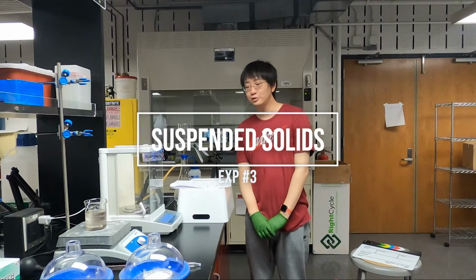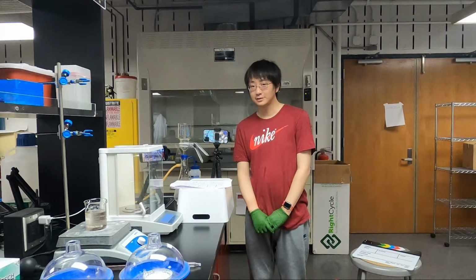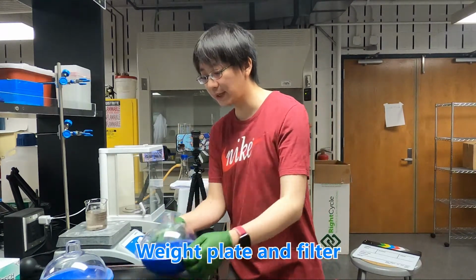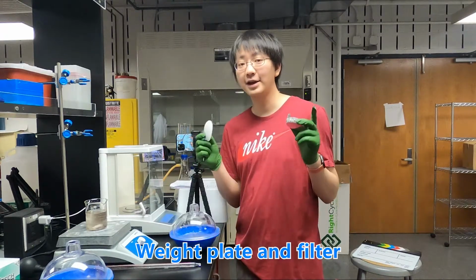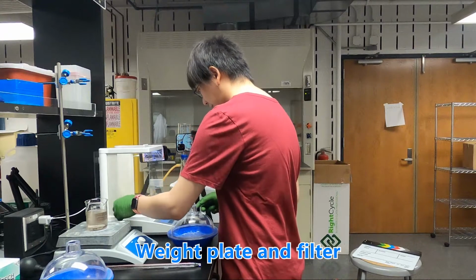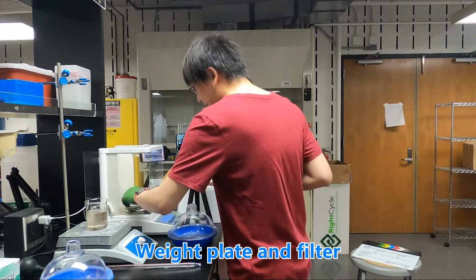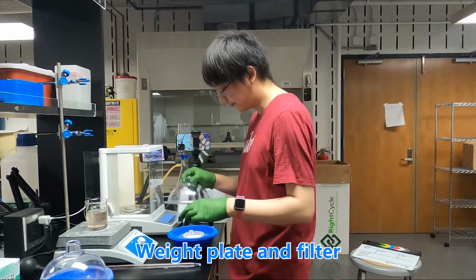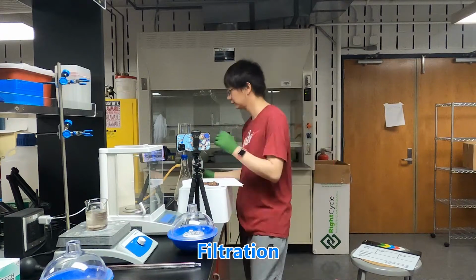So now we are going to do the suspended solids experiments. And so first we need to measure the weight of the aluminum plate with the filter. So we measure them together. And then we store it in the desiccator. And so the next step is filtration.